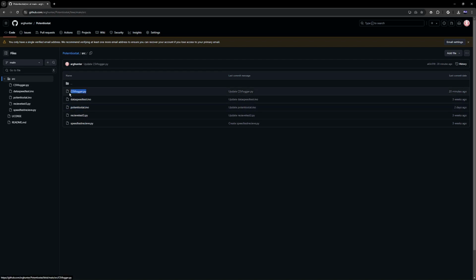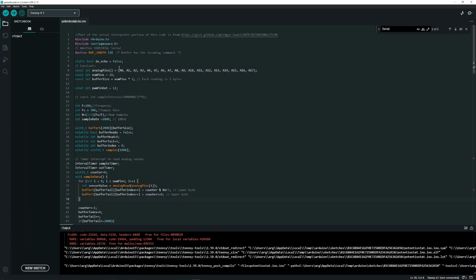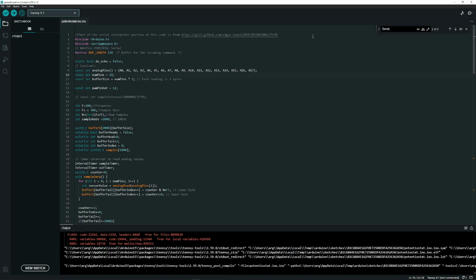potentiostat.ino and csvlogger.py. Potentiostat is what runs on the Teensy. So if we open that in Arduino IDE, I'd suggest installing the Teensy board layout first. But then once you've done that, make sure you change the CPU speed to 720 megahertz and the USB type to dual serial. The program will not work without this. Then hit the upload button and you should be off to the races.